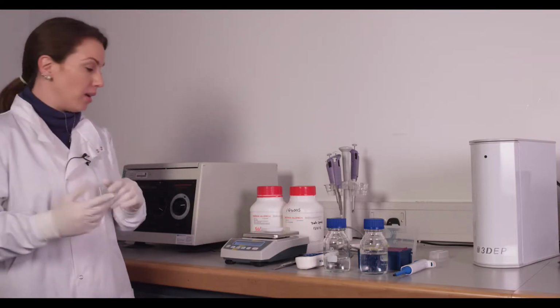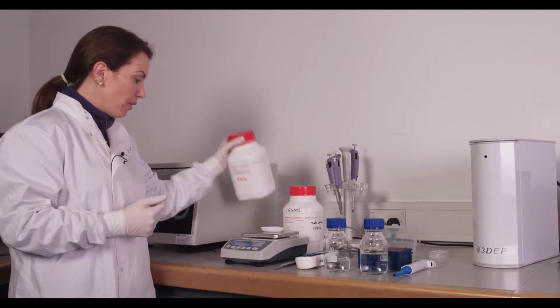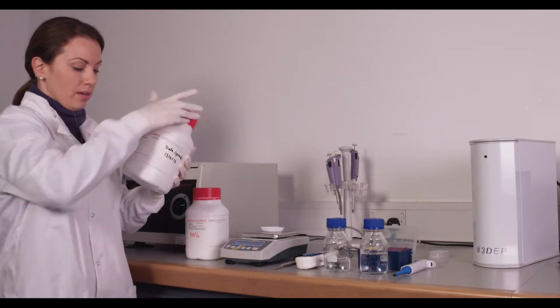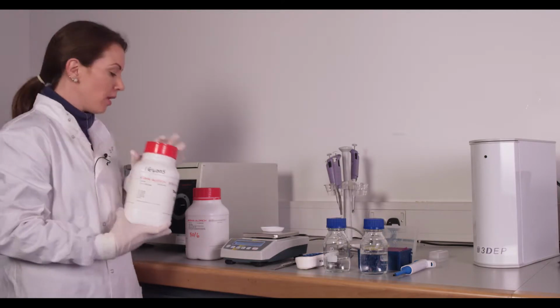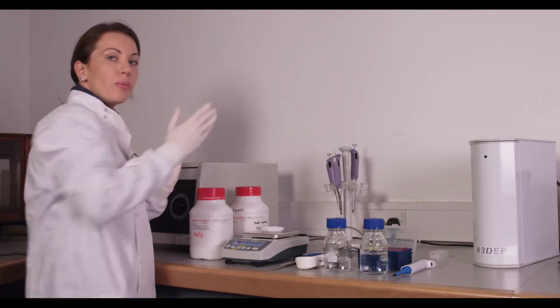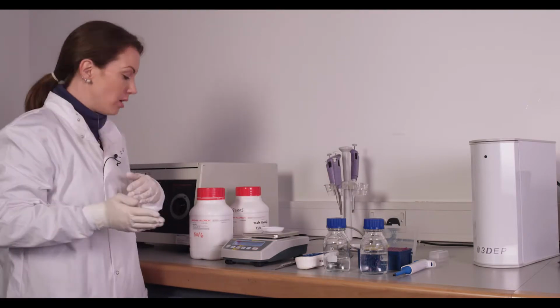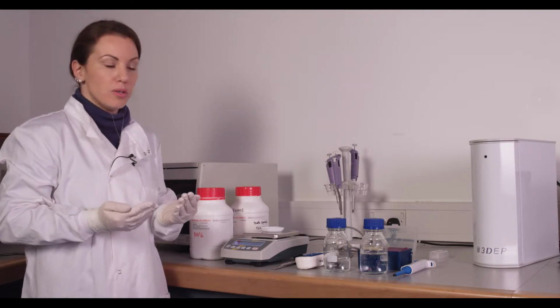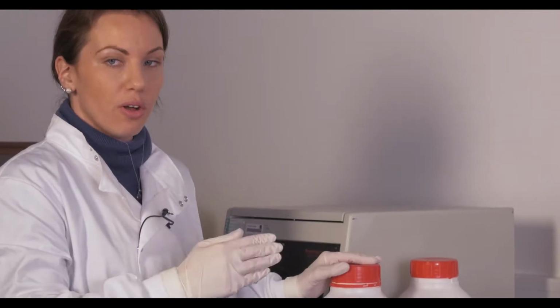The amounts are dependent on what osmolarity you need. So typically for mammalian cells, we'll be working around 280 to 300 milliosmoles. So the amounts for that recipe are 8.5% sucrose and 0.3% dextrose or glucose. These will give you an osmolarity somewhere in the range of 280 to 300. This is weight percent volume, so your total volume, if you're doing 100 mils, will be a little bit less of your DI medium, and then you'll add your sugars in for a total volume of 100.